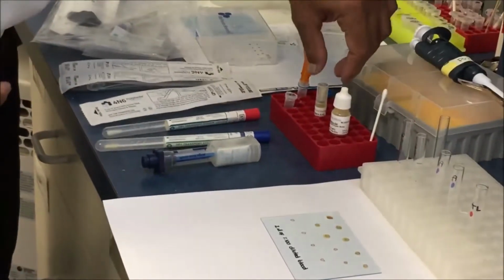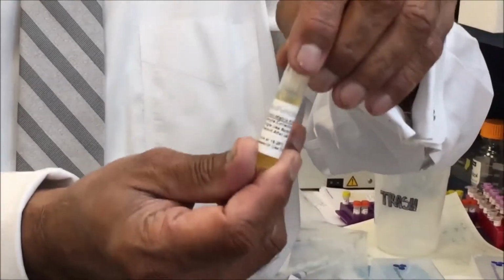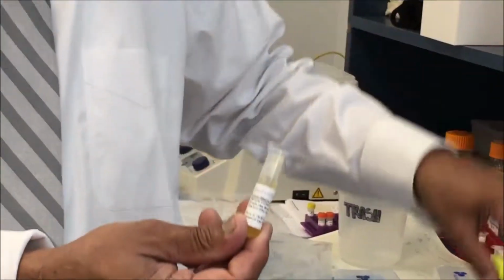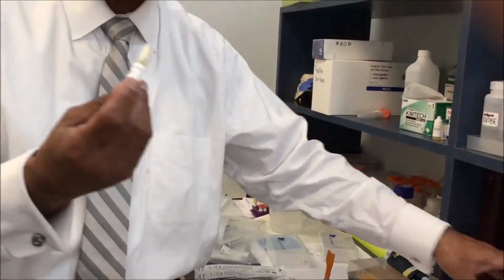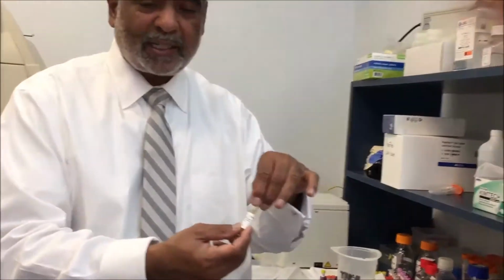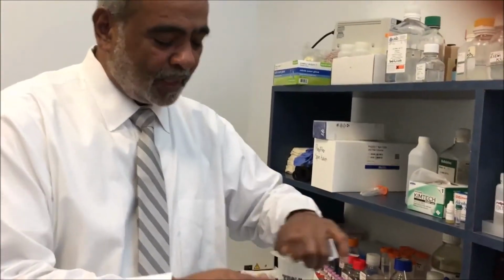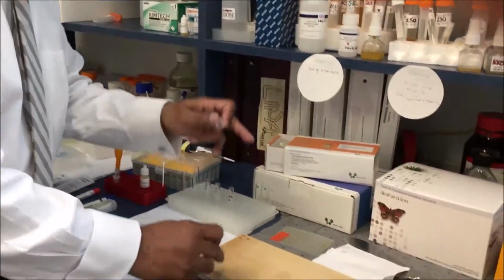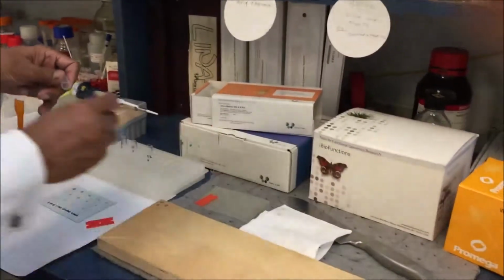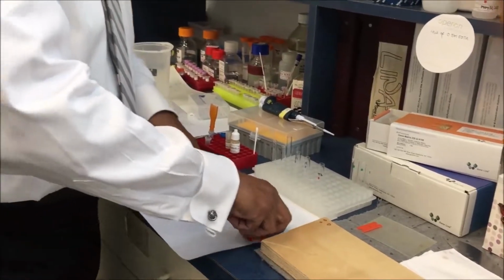The other type that Omni-Matrix is supplied in the kit is a small spray bottle. If you notice, these are the small dispenser type bottles and the spray bottle. Each one of these is for only one session. So if there's a sample collection session, we will use one of these bottles and then discard it. And a spray is for when an area is barely visible, like a fingerprint, so we can just spray those areas and then scrape it off from the surface.